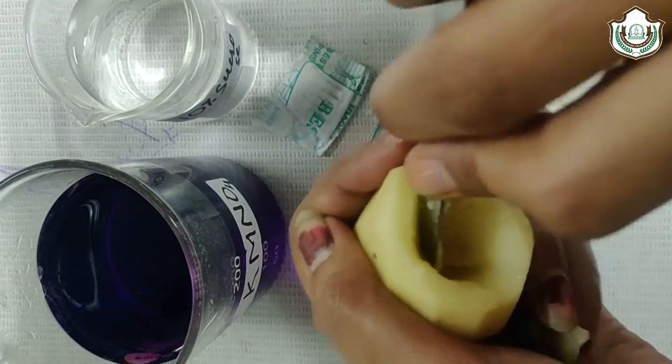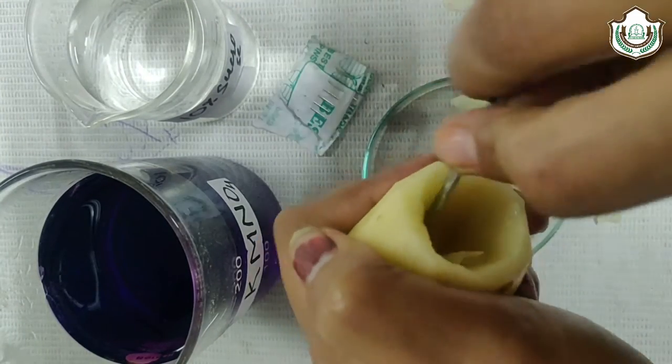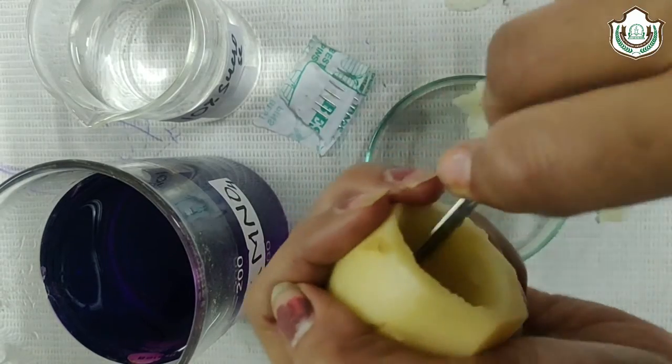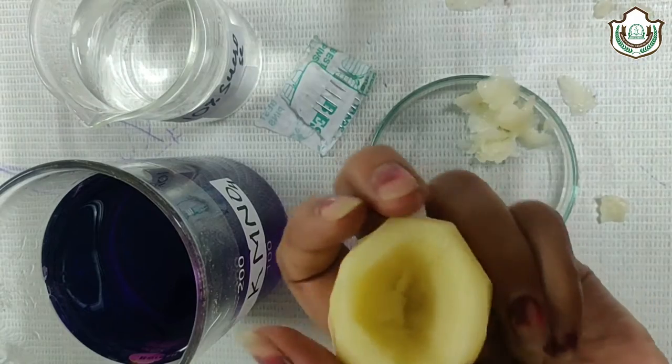Make sure that the layer will not be cut off. Peel smoothly the layer to make it thin.